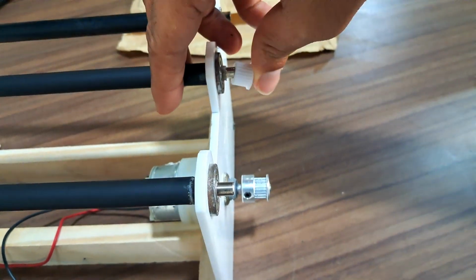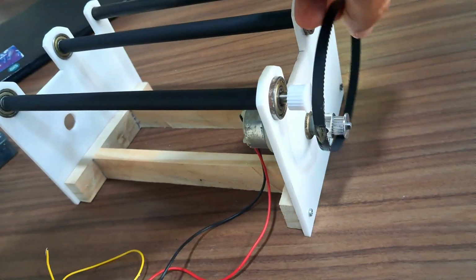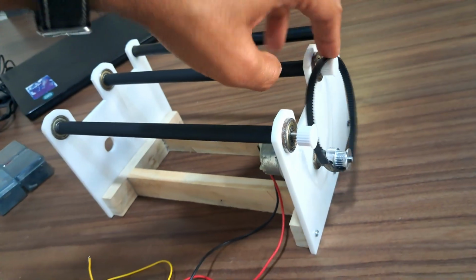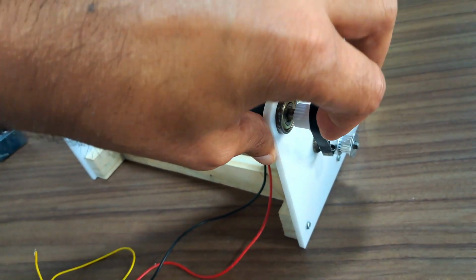I am placing the gears on only two rollers. The third one will be free, because the third one will hold the small load, so it can handle it.